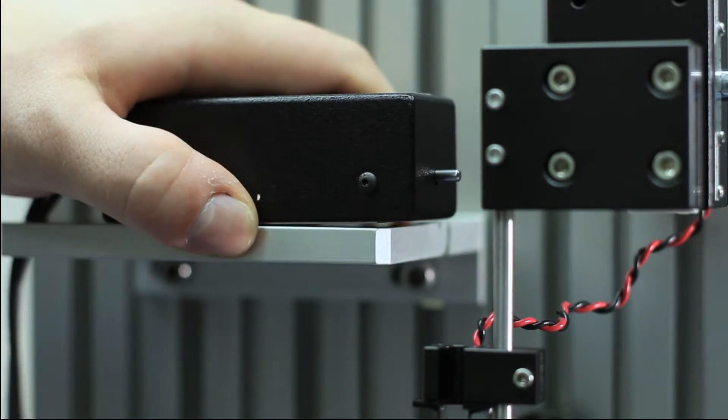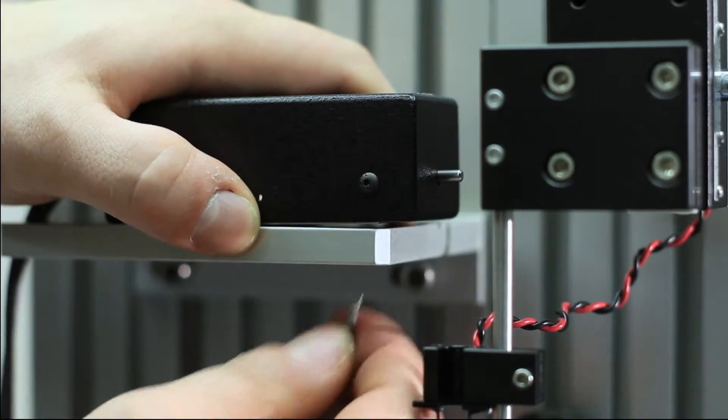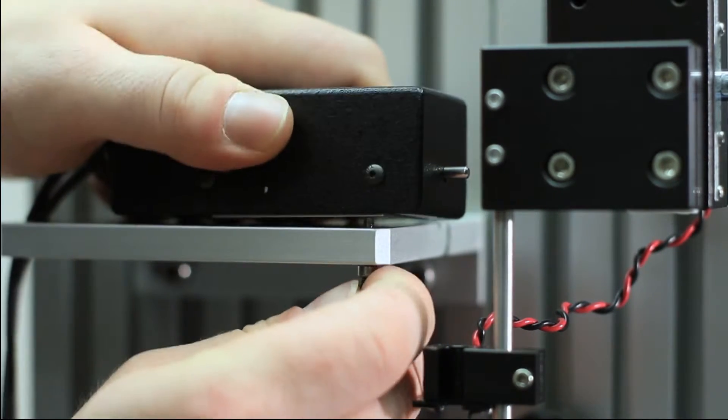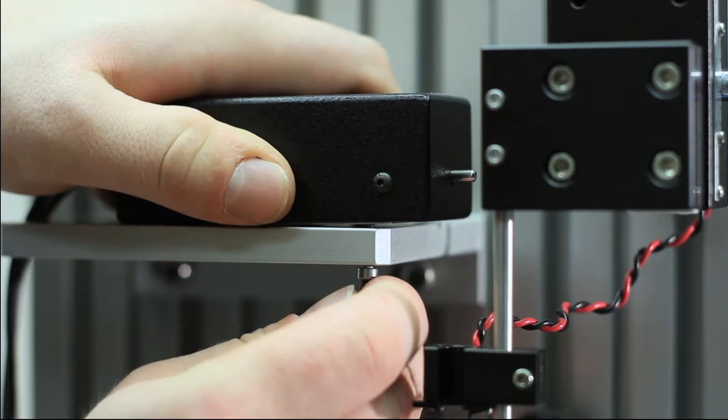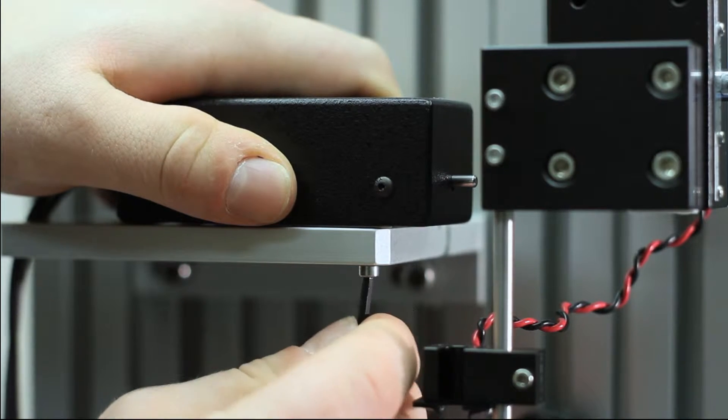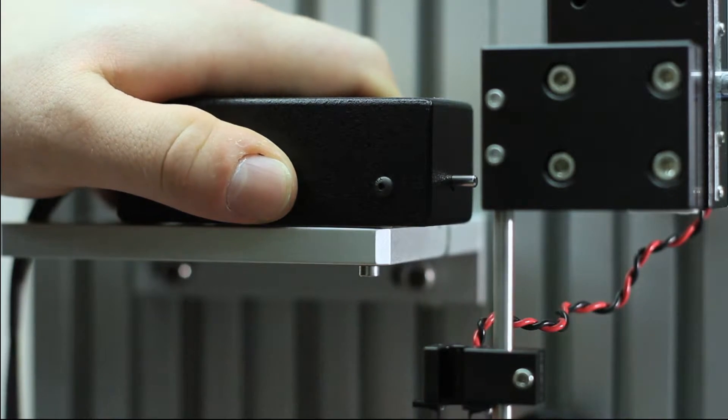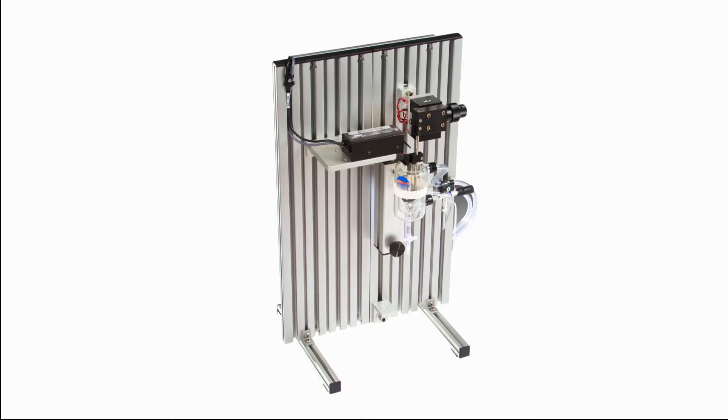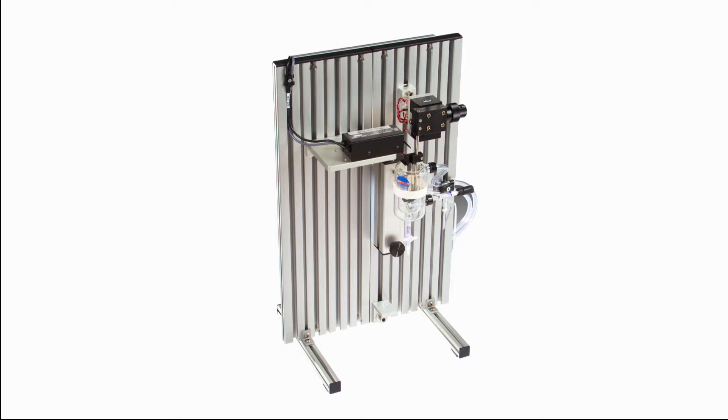Mount the motor to your test apparatus with four screws, as shown here on our 800A in vitro apparatus. If you are not using the ASI apparatus, contact us for further information regarding mounting solutions.